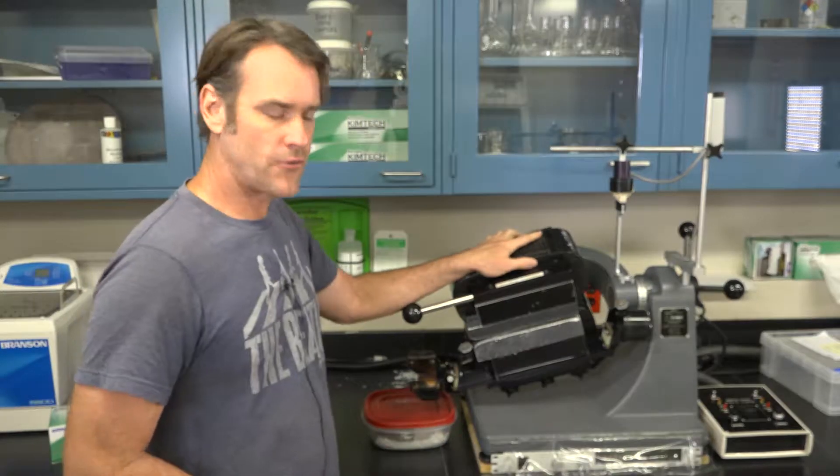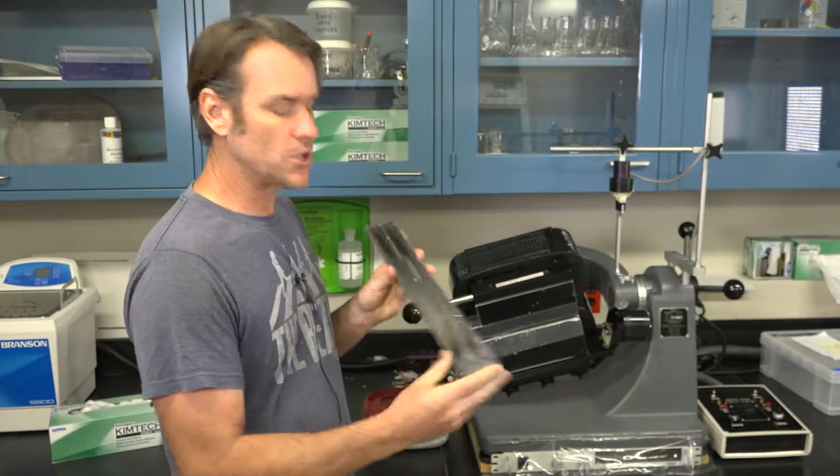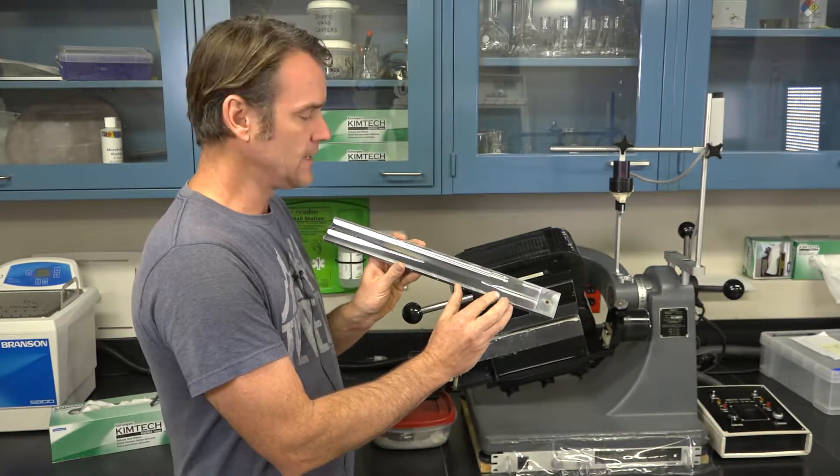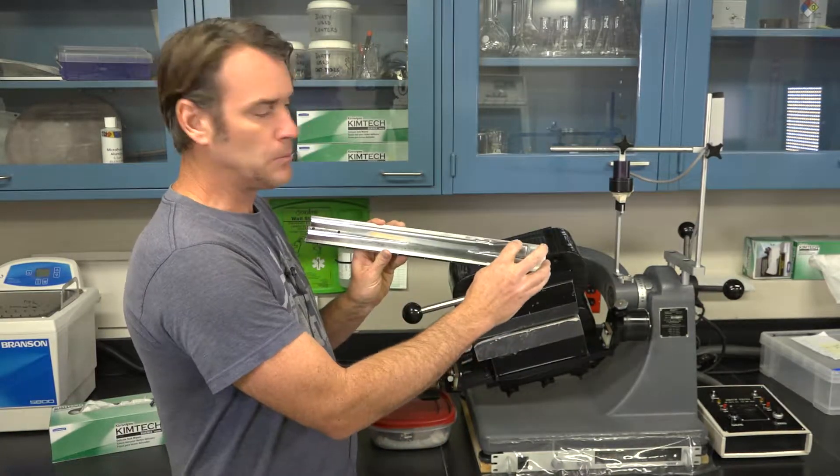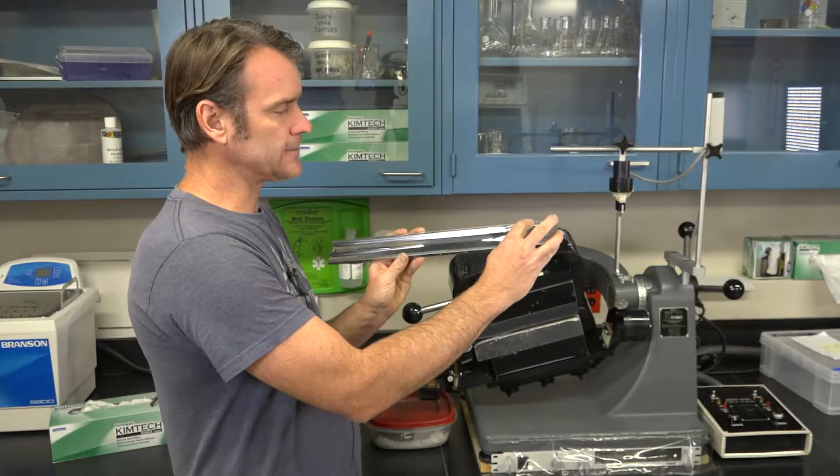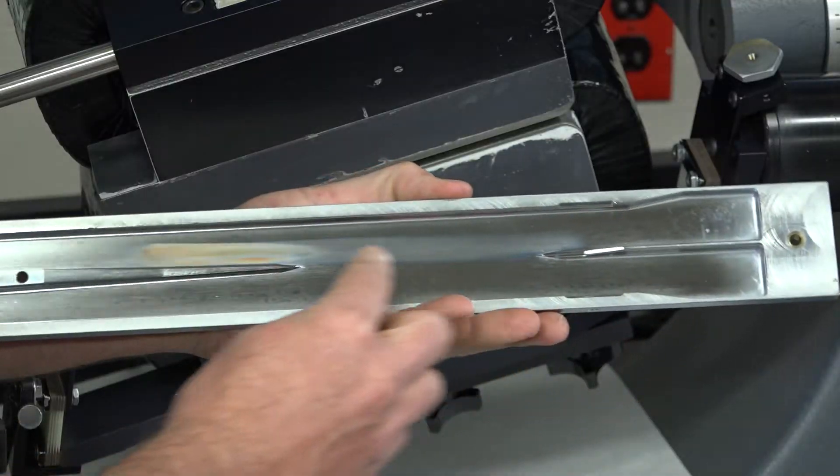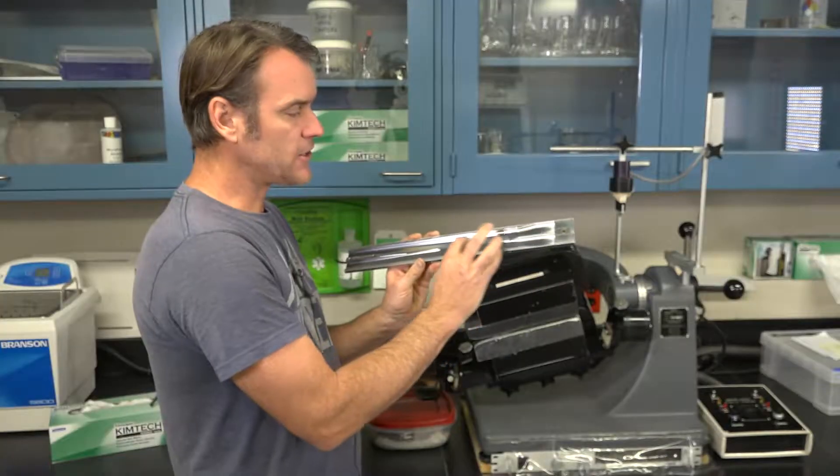In this video I'm going to teach you how to use the Frantz. This Frantz is the newer split barrier Frantz.